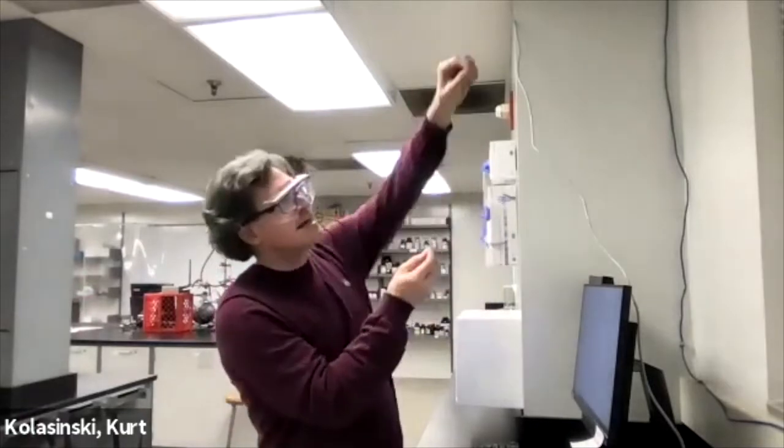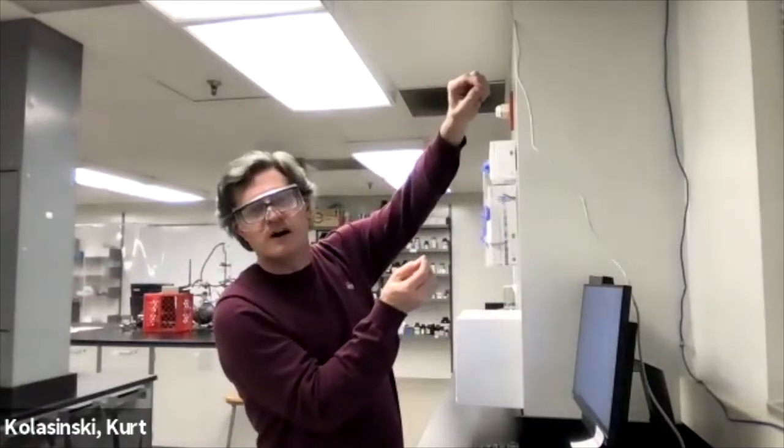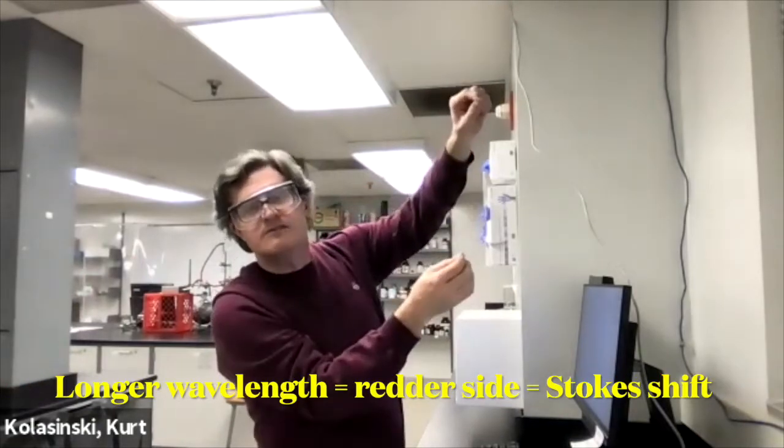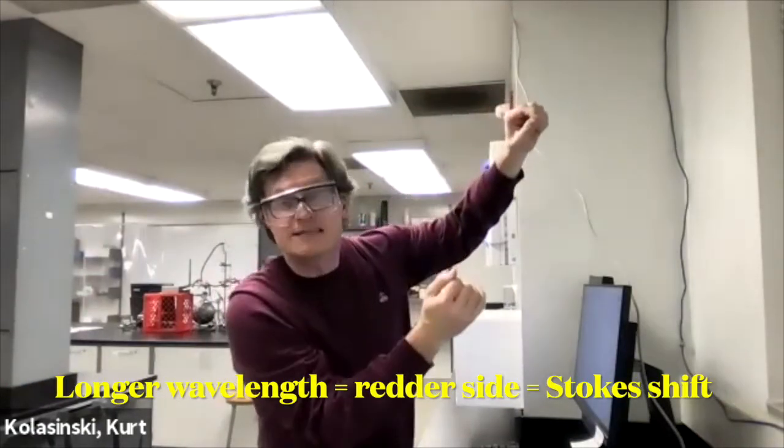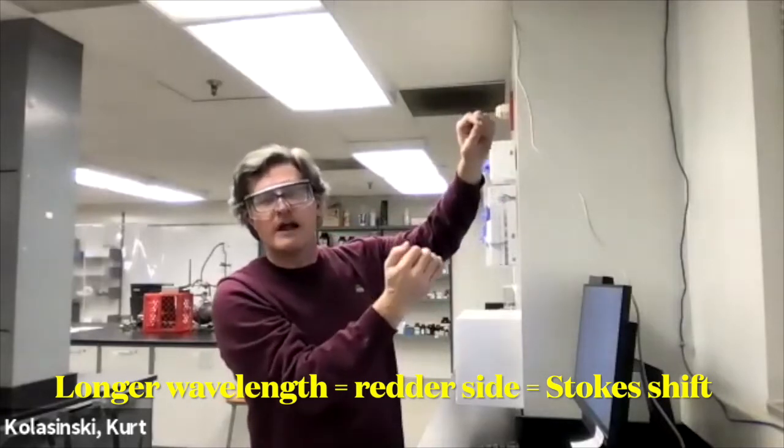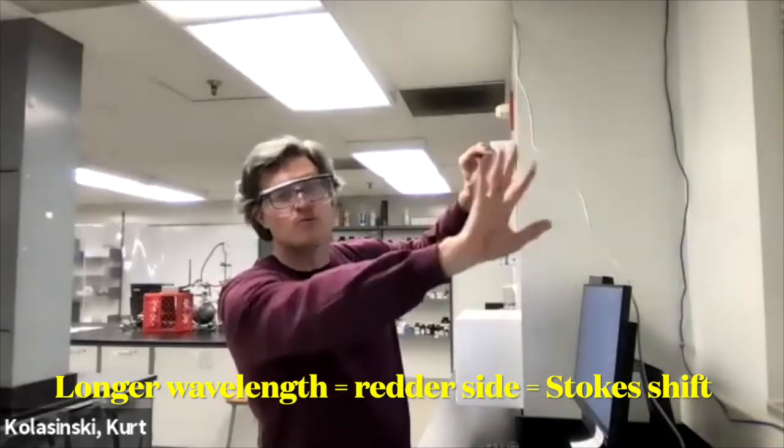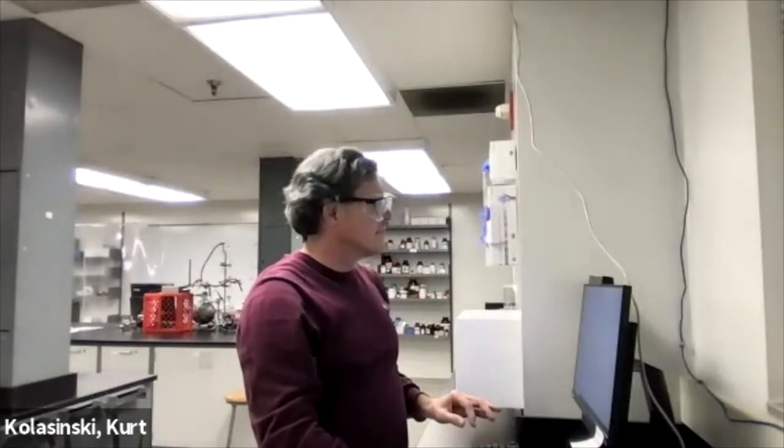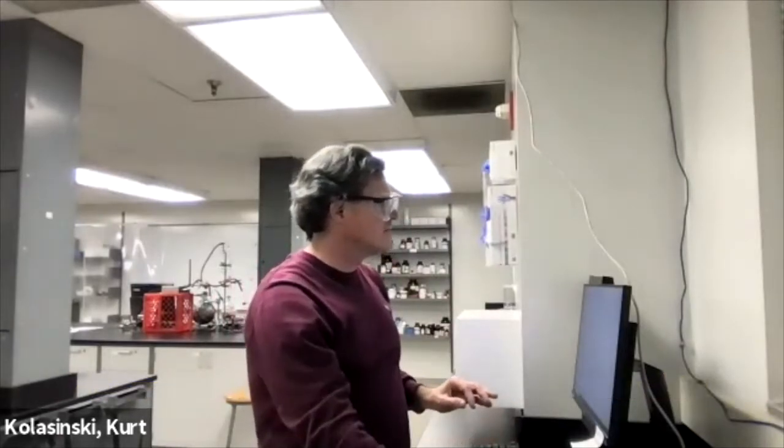You always detect to the red, to the red side, to the long wavelength side of where you excite. Because you're going to excite with a photon a molecule to an electronic state. And when it relaxes, that photon that comes out is always going to be the same or less energy, lower energy than what you excited with. That's the red side, the longer wavelength side. So let's do it from 500 nanometers to 550 nanometers.